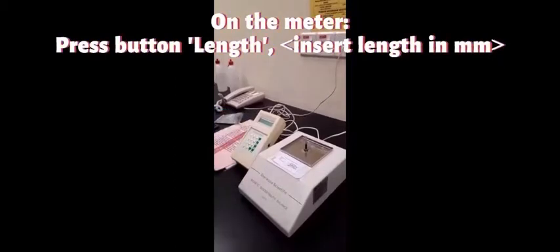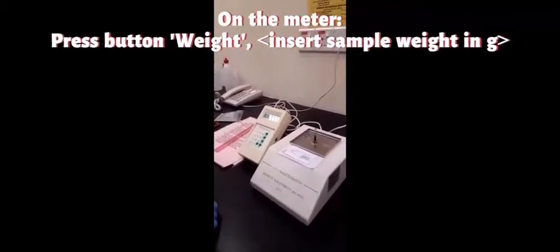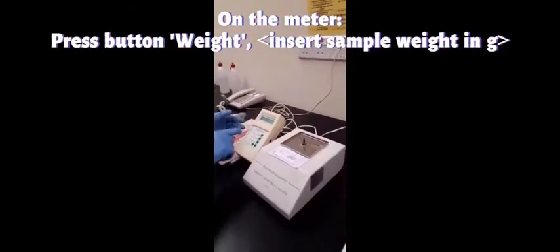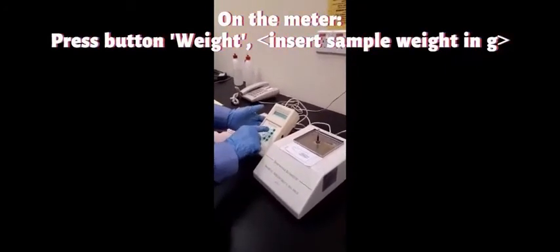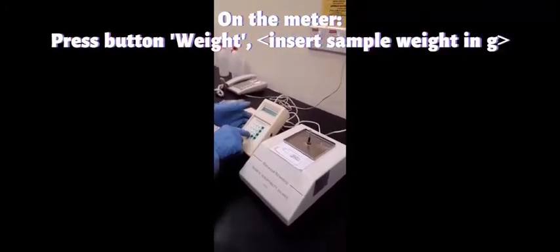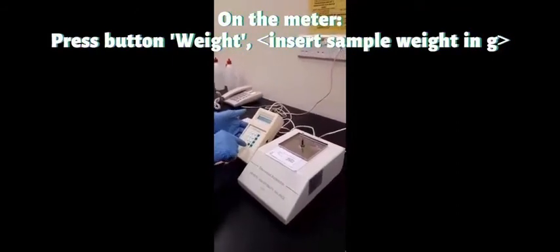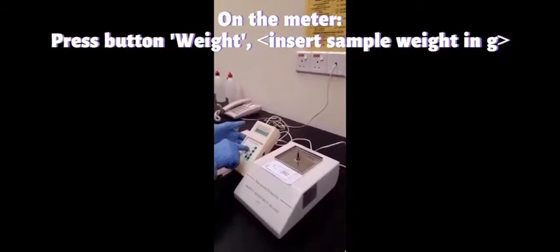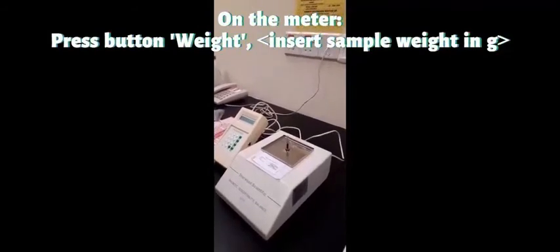Then we press weight. By pressing weight, you have to insert the weight of the sample. So the sample weight is 0.1568 gram.